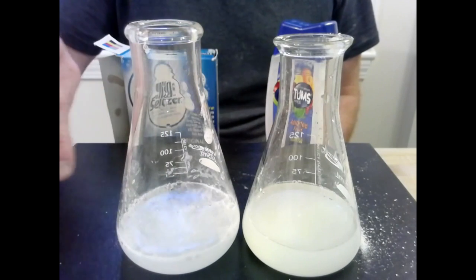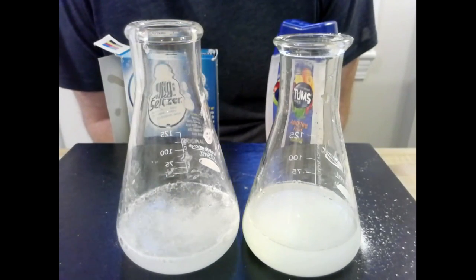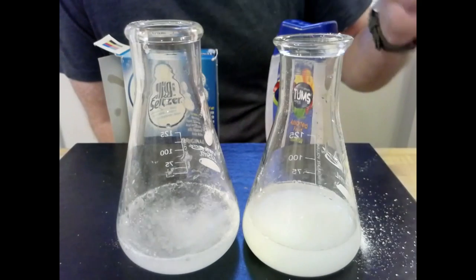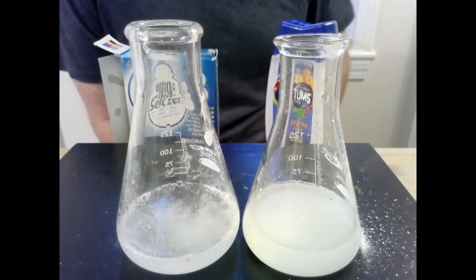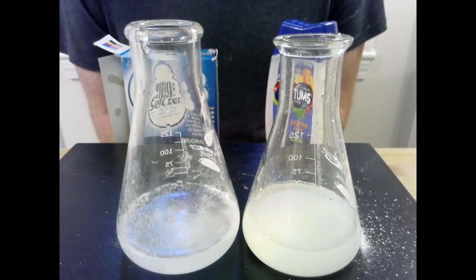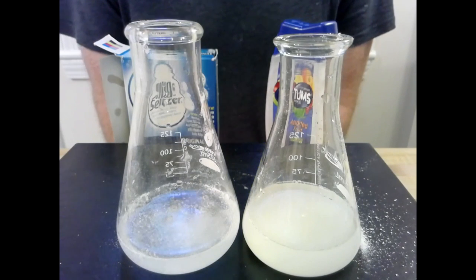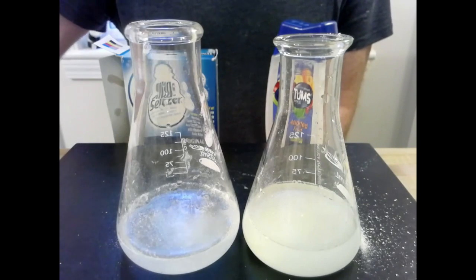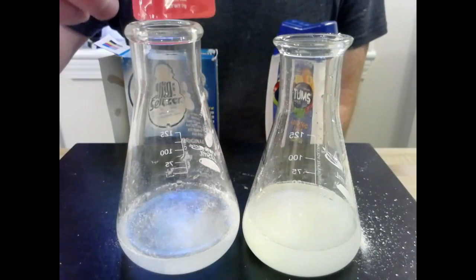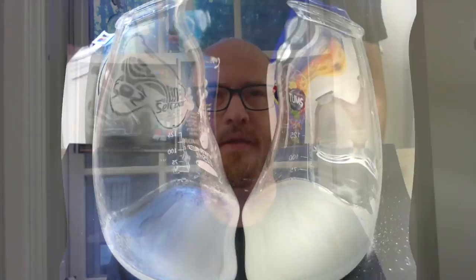as bubbles, and we've got a neutralization reaction, essentially trying to turn all of that acid, same as over here, trying to turn all the acid into what would be lower hydrogen ions. And in that case, taking the edge off of anything you might have introduced to increase the acidity of your stomach. Now, I think at this point you're starting to understand and get the gist of how acid-base reactions work.